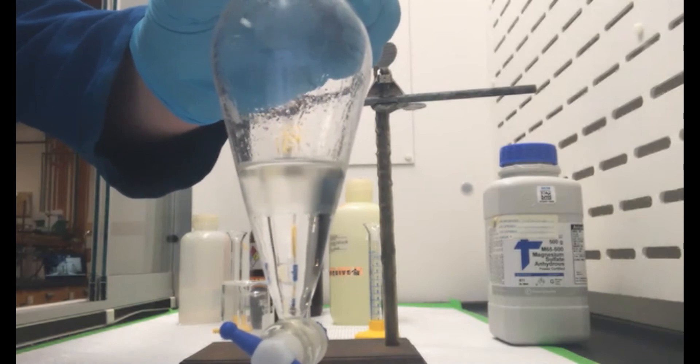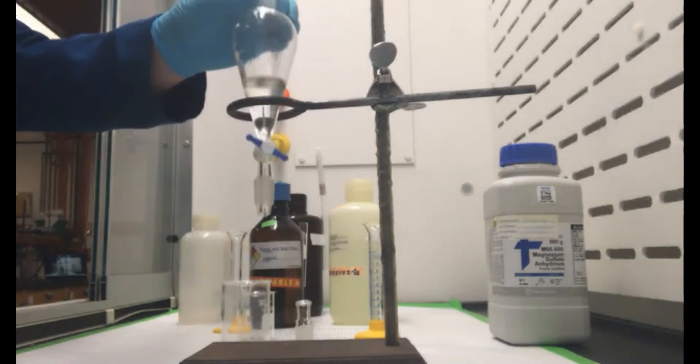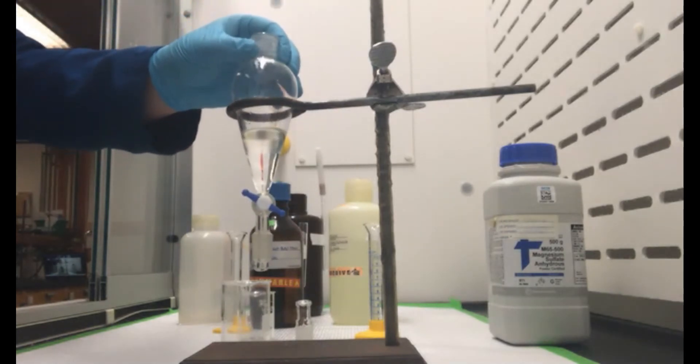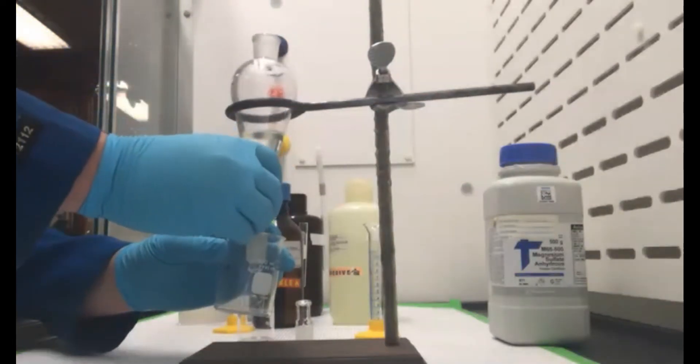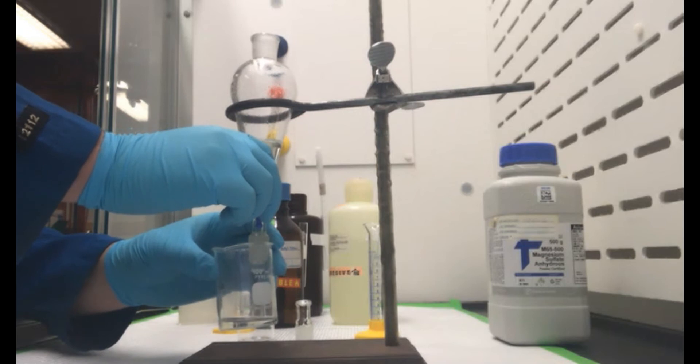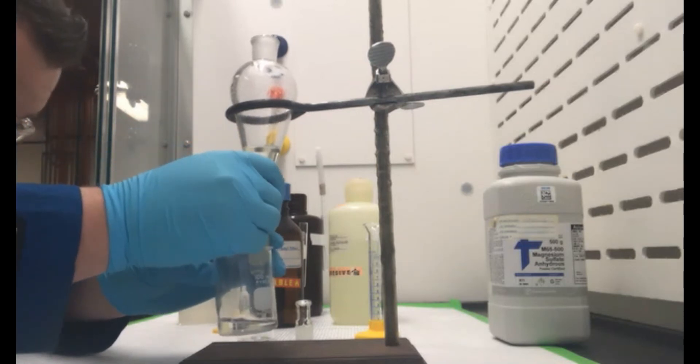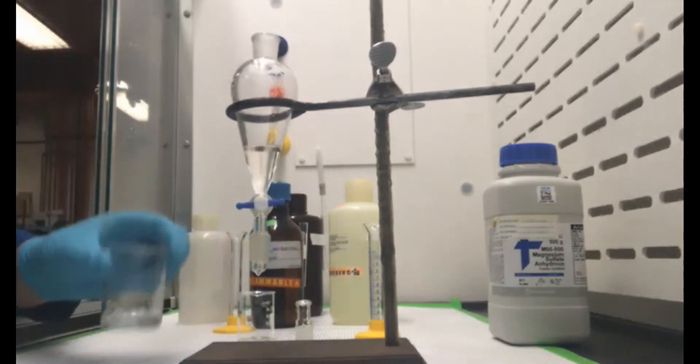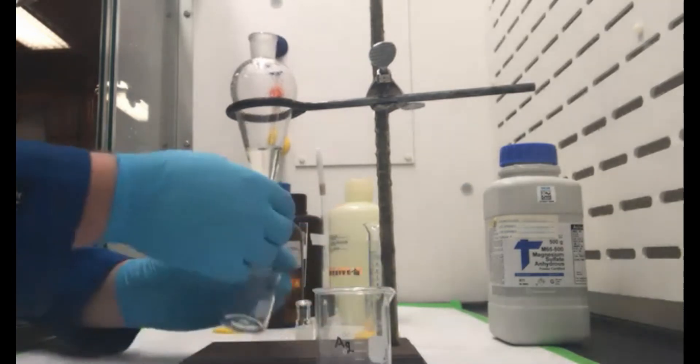And once that emulsion has nice and kind of separated it out, we can go ahead and drain off our water. So I'm going to go ahead and collect the water here. We're going to have our water there and we're going to collect the organic.